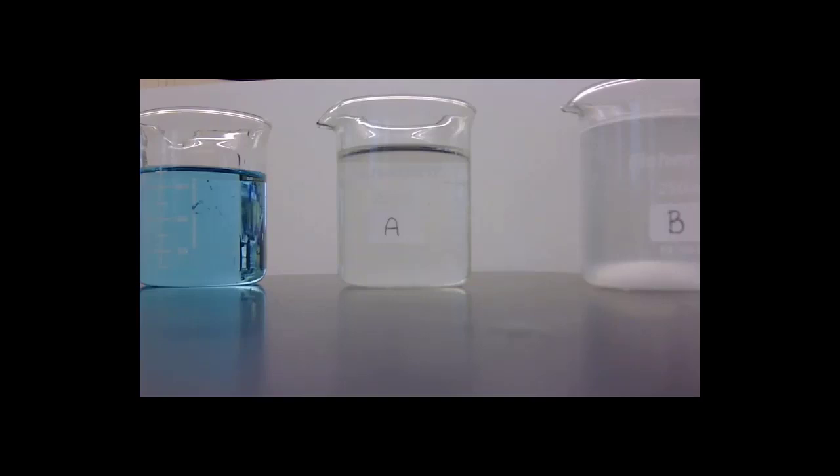That concludes our exercise on osmosis and diffusion. The data that you collected from this in the form of weights from the potatoes at the beginning and at the end of the exercise, you will record on your data sheets. You will submit that online. So thank you very much.